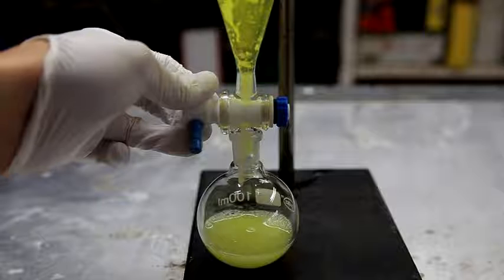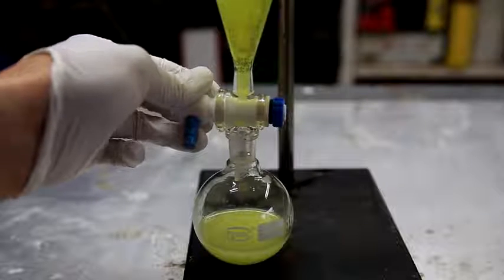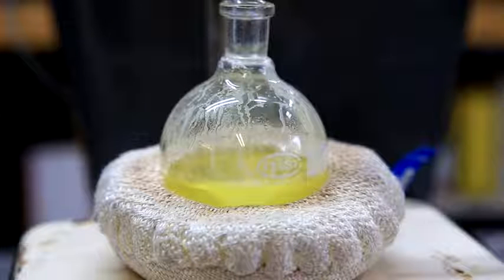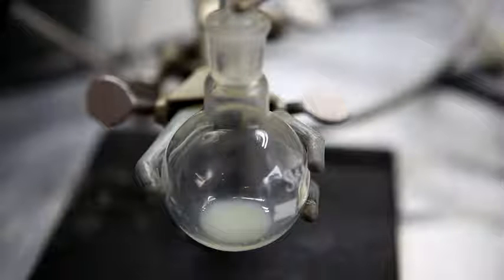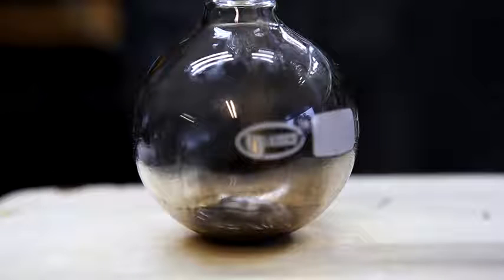To further purify the nitrobenzene of water and of the di and trinitrated product, we're going to carry out a simple distillation. The fraction that started coming over at around 208 degrees Celsius was collected. For safety reasons, do not let the distillation flask get any hotter than 214 degrees Celsius. Also, it's important to not distill until dryness. As the distillate came over, it should be a cloudy white color because there's still water present in it. In the distillation flask, we're left with a thick brown goo.